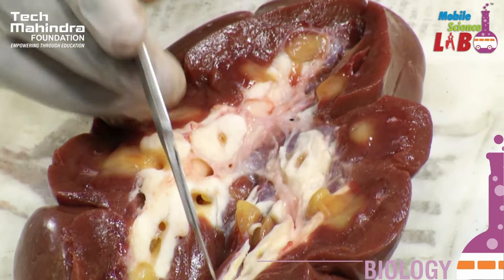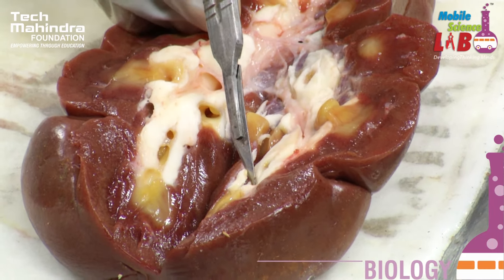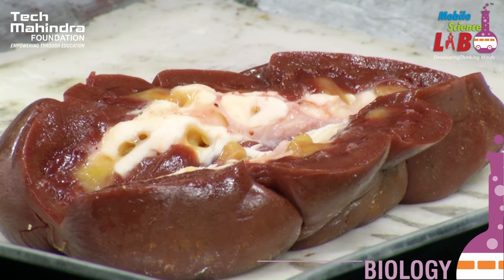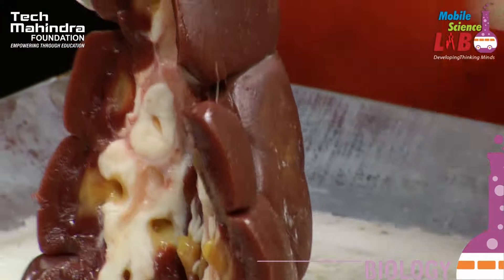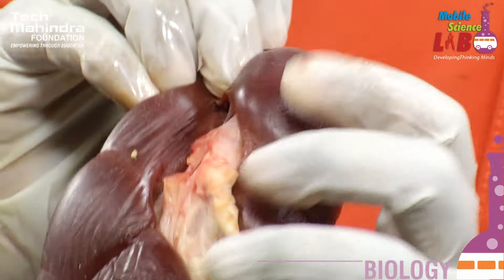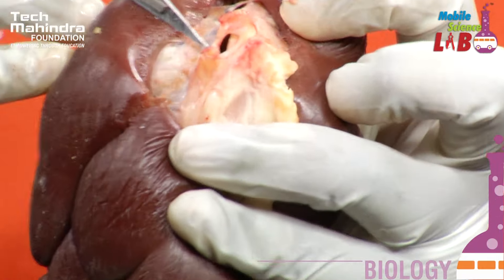Between the medulla you will find the nephrons. Nephrons are the functional unit of a kidney. The function of a nephron is to filter the blood. When I turn the kidney, you can find an opening hole here — a tube-like opening.